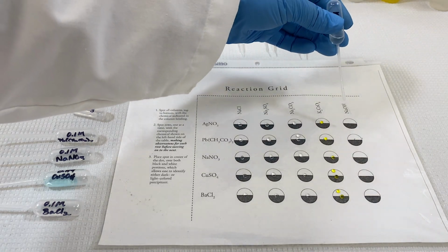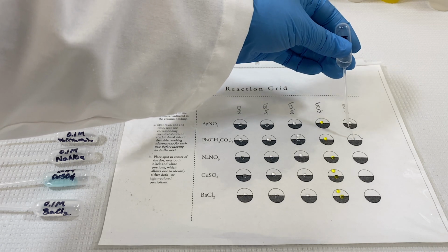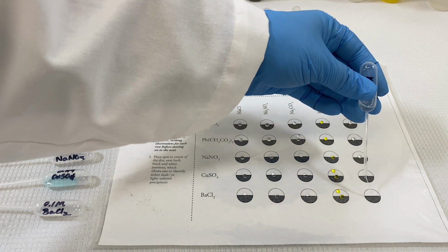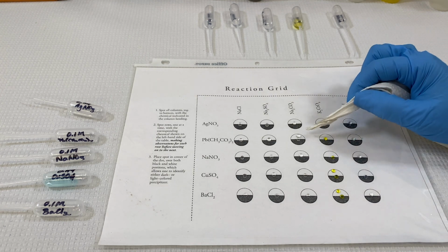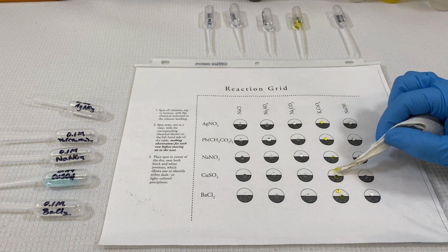At this point, we have no reaction. Each spot just has one particular reagent on it. The reaction will occur when we add a second reagent, those shown to the left side, when we spot each row.